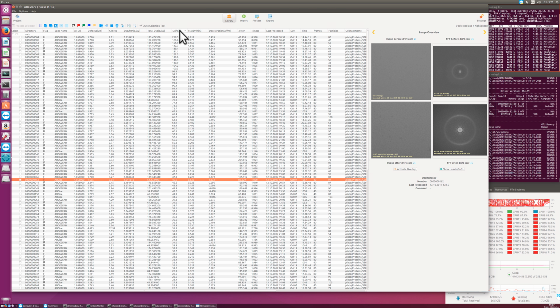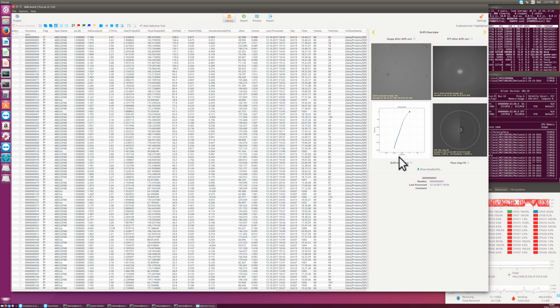We can now sort this table here by, for example, the amount of drift, the total drift. And then these would be the movies that have the highest drift here. This one. And then I can look at this drift profile. That still looks good, and it's 25 nanometers in drift over the movie.